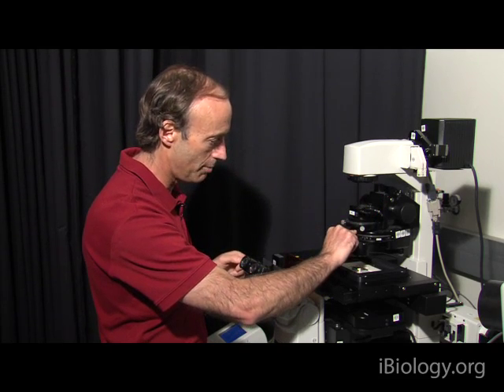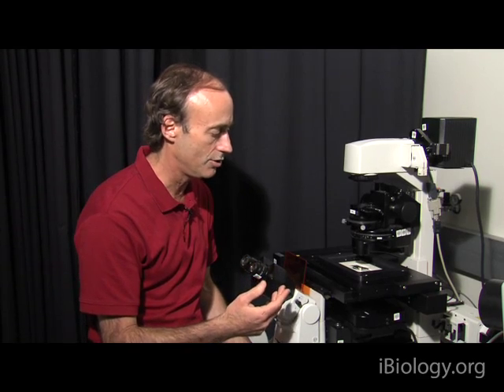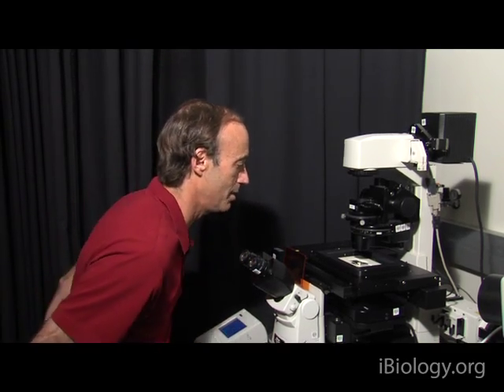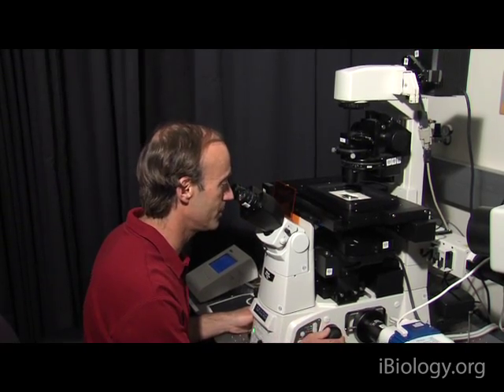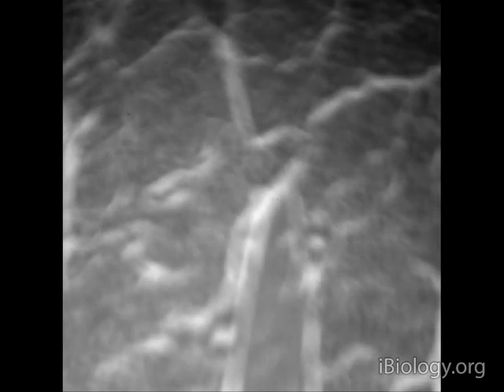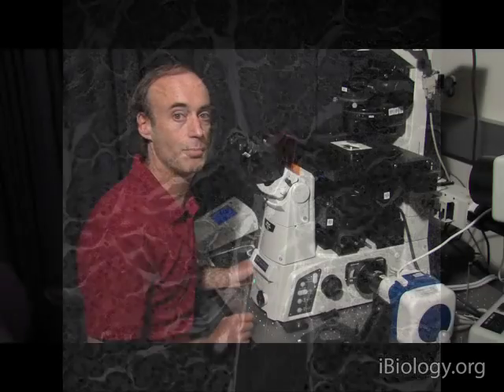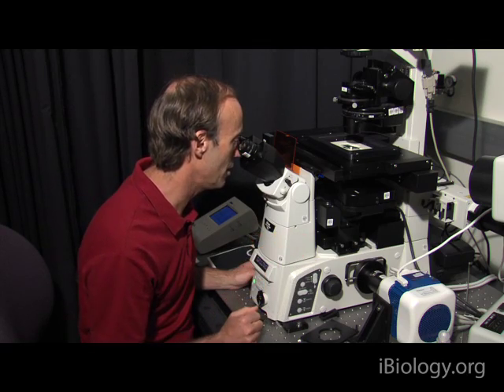That lets through more light. I'll open up the condenser diaphragm. This microscope has an adjustable light source on the other side, so I'm going to adjust the light so I can sit down at the microscope and have the right amount of light to focus. Now I'm going to focus on the specimen with this focusing knob until I begin to see the specimen getting clearer and clearer — until finally, there it is. It's snapped into focus. That's the first step of setting up Köhler: being in the correct plane where I can now image the specimen.